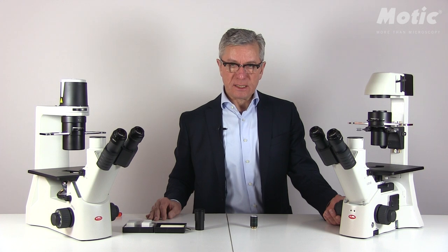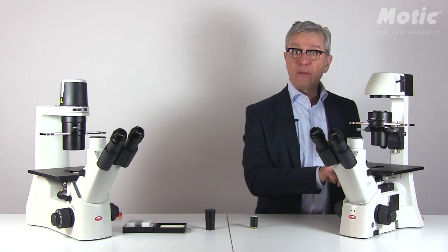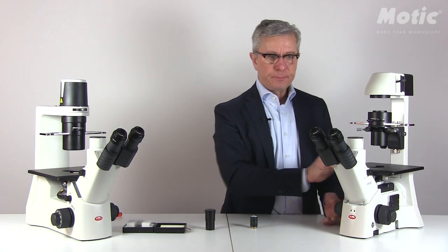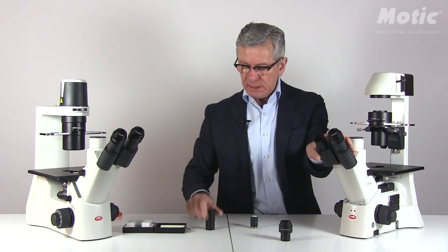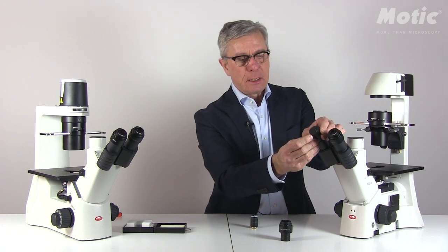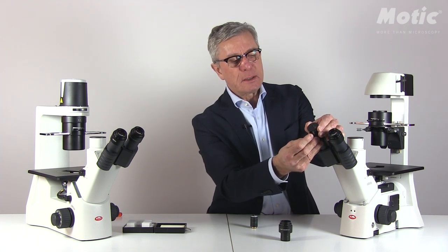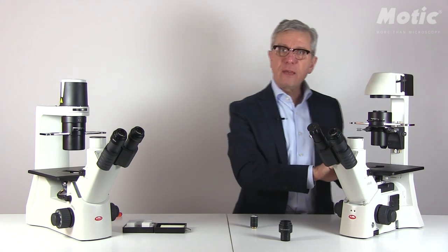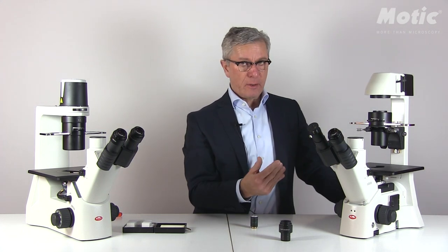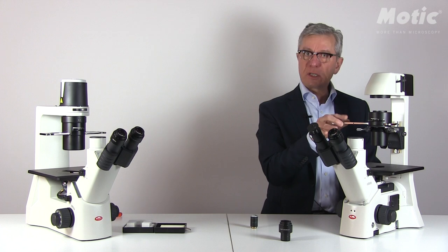Now we can start with the phase contrast setup. Once the brightfield setup has been done, make sure that you have a phase contrast objective in the ray path and the sample in focus. Please remove one of the eyepieces and replace it with the so-called centering telescope, which is an integral part of the standard packages. Loosen the screw, pull out the inner optical part of the centering telescope, and try to find the so-called back focal plane of the objective. This is the plane where you can see the dark ring. Once you have found the dark ring, push in the correct and corresponding phase ring size.